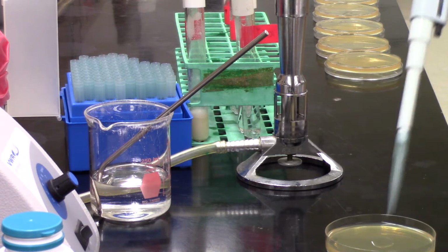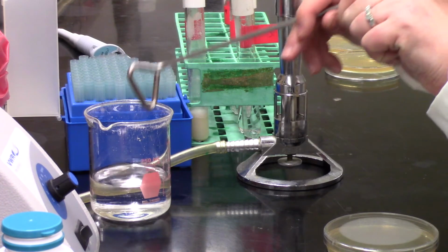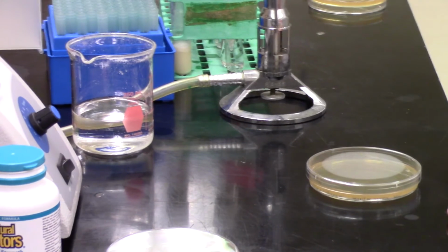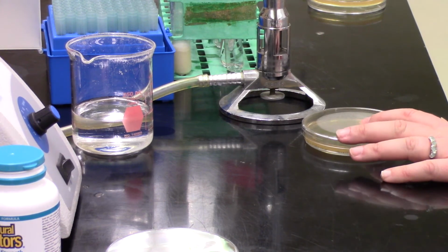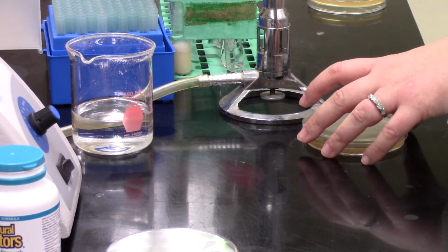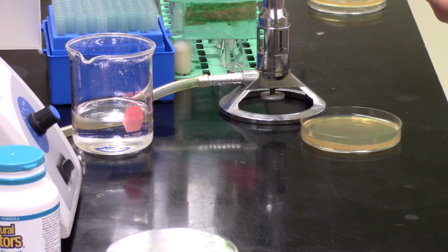So at this point, Sabrina is moving on to the next plate. So now we are working with our 10 to the minus 5 dilution here. And she is now going to put 100 microliters of that onto a spread plate. Spread it in. She's actually going to not use the turntable just to show you how that looks as well. And that plate now, if you remember back to what we talked about in class, that plate is now actually a final dilution when you're calculating back of 10 to the minus 6 because you only put 100 microliters on that plate. She's just testing her spreader before she starts spreading.